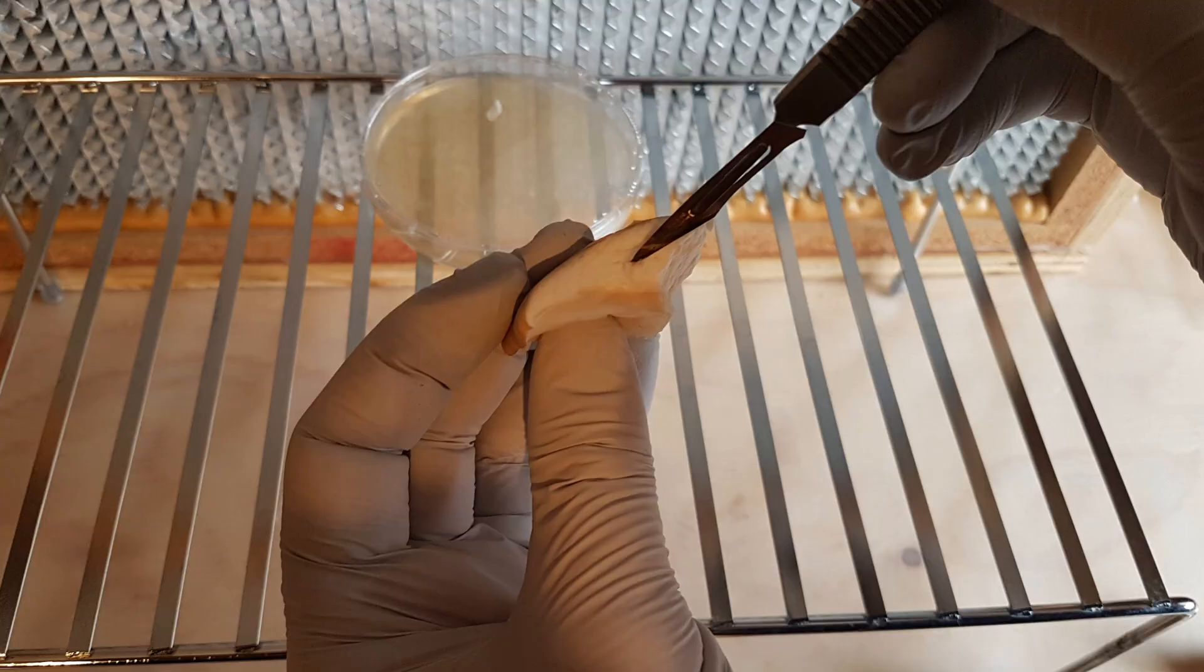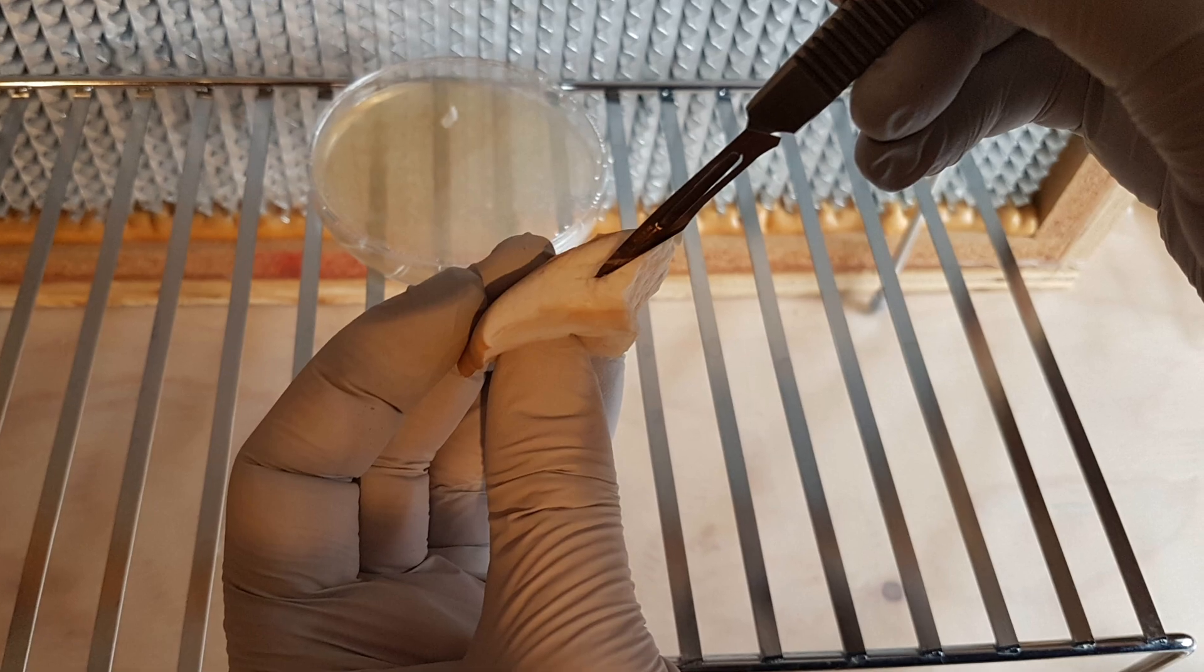Hi, this is Tony from FreshCapMushrooms.com and today I wanted to show you a process for cloning mushroom fruit bodies. Now why would anyone want to do this?